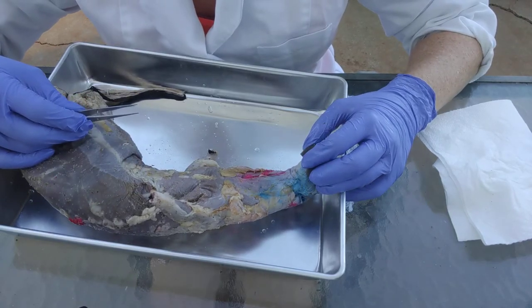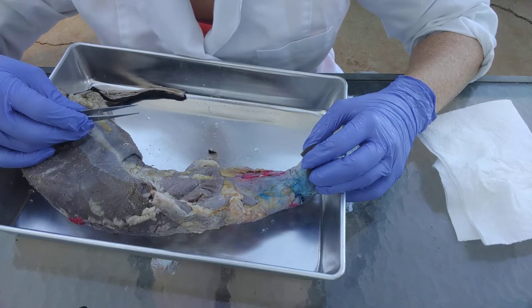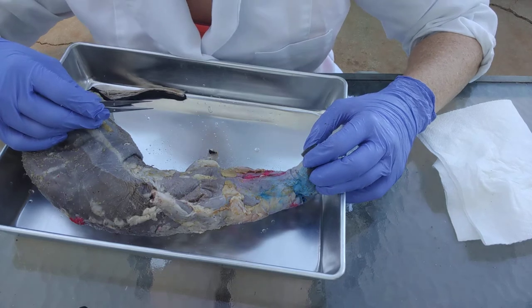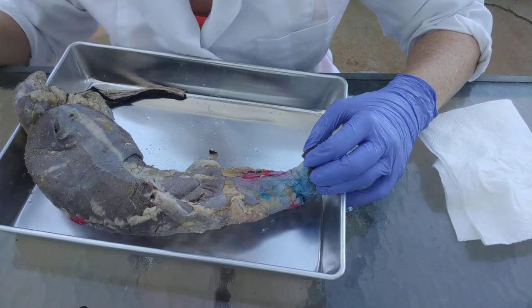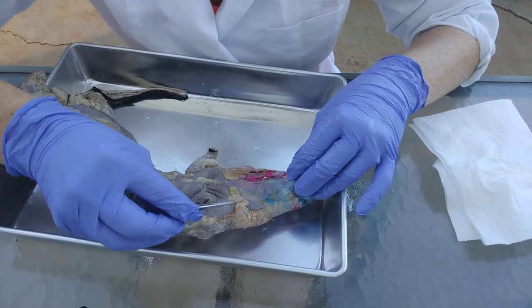The first thing I wanted to point out is the word 'dissect' means to separate. It does not mean to cut. So we are not going to be cutting any of the muscles, with the exception of reflecting the sartorius and also in the very back. So: no cutting.